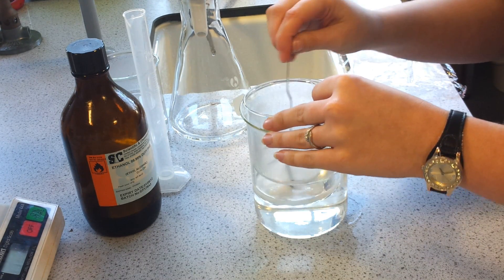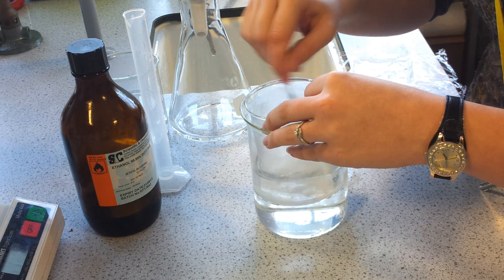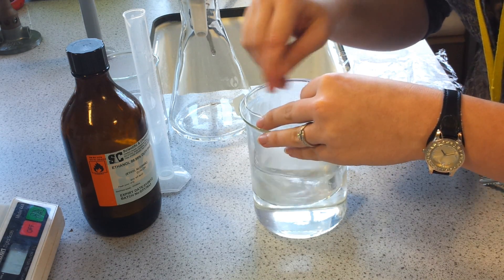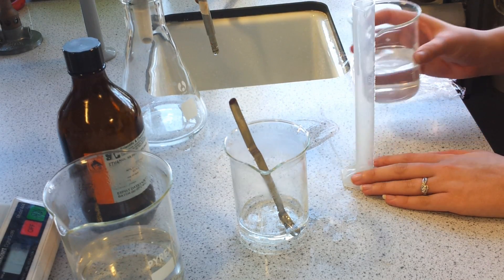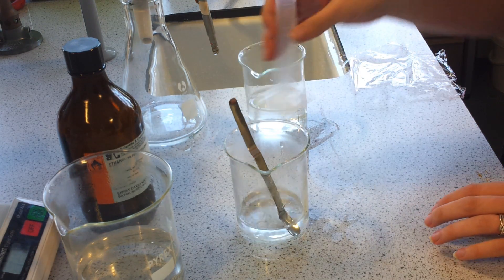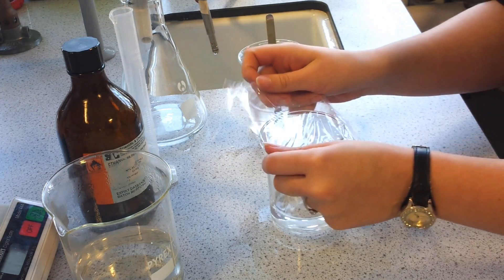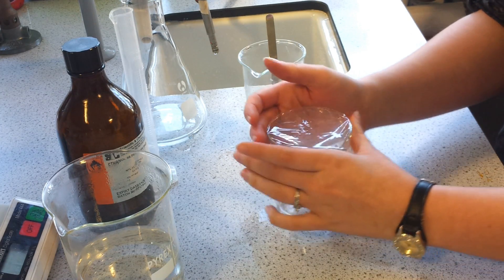This will be stirred in some warm water to heat it up and dissolve the crystals. Now the aspirin crystals have dissolved in the ethanol, we are going to add 25ml of warm water. This will be covered and the crystals will start forming again as the solution cools, so to speed this up we will put it in the fridge.